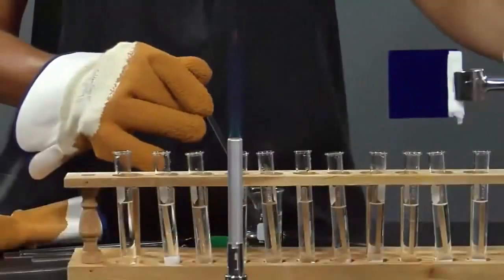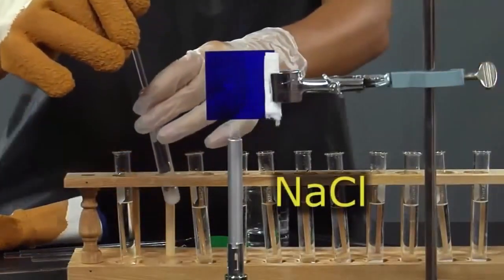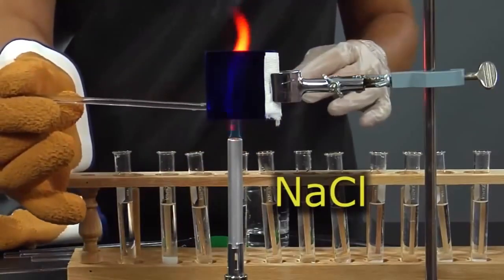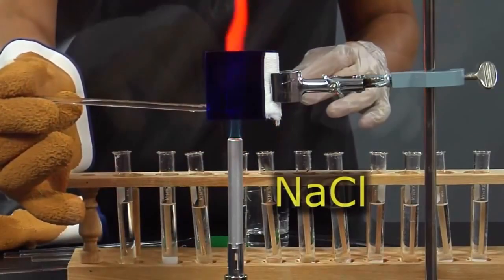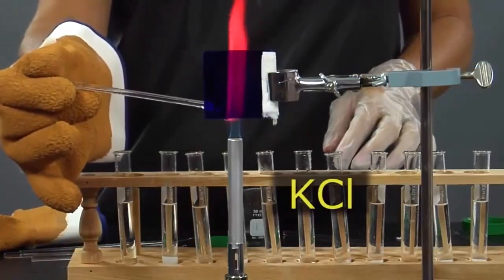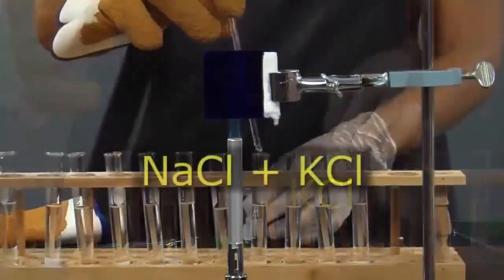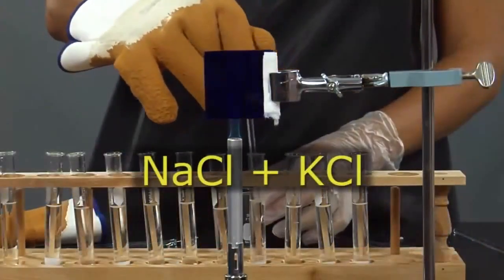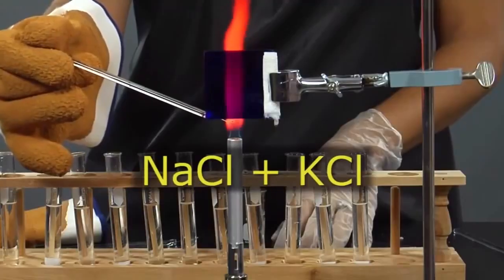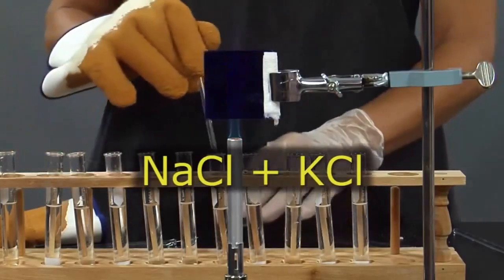We need to conduct 3 tests. First, let's see what it looks like with the sodium chloride solution. The yellow color has been absorbed. Now, let's do the same thing with the potassium chloride. We now can see the violet from the potassium. Now we will repeat the process with the solution that is combining both. Notice how we can only see the violet since the yellow is being absorbed by the glass. Enter this data.